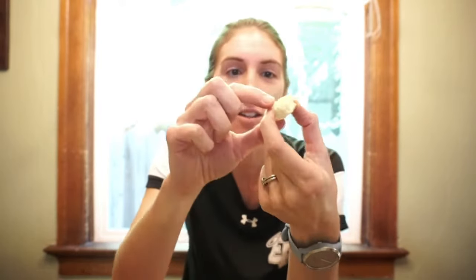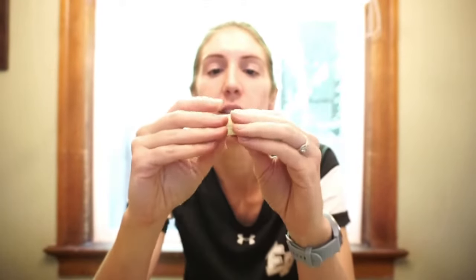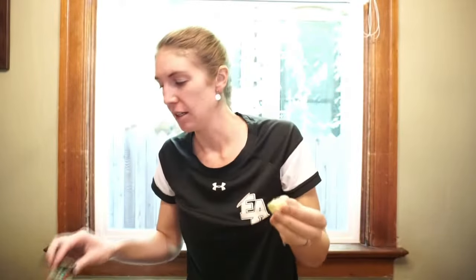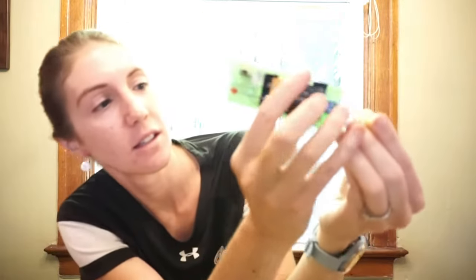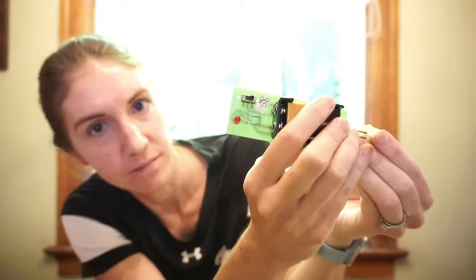Okay, next up we have this yellow stuff. This is just capital S, just S, that's all it is. Take a look, see if you think this is shiny or dull. Let's see if I can bend it. Oh, oopsies. I accidentally broke a piece off. Ooh, smells bad. Let's see if we can conduct electricity with this. And finally, is this thing magnetic?